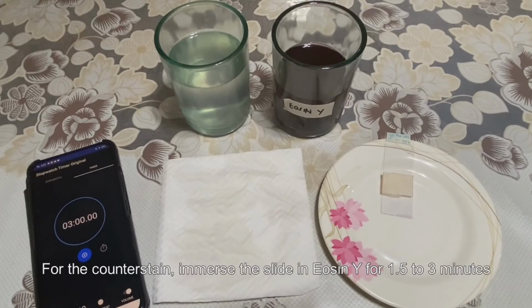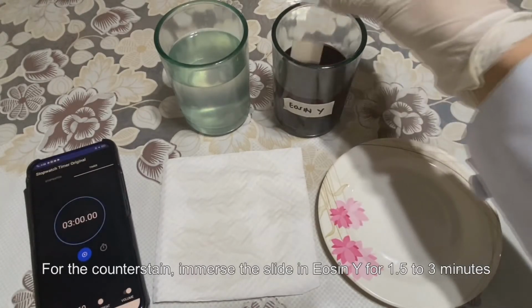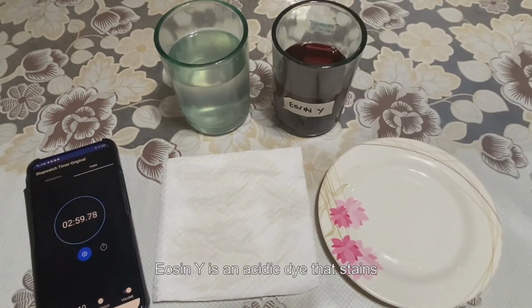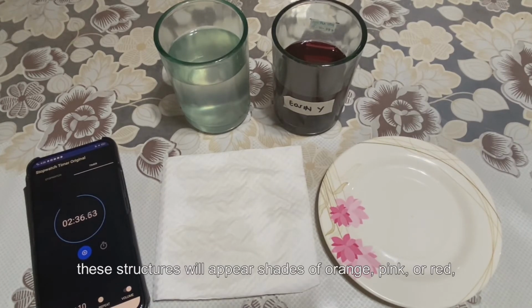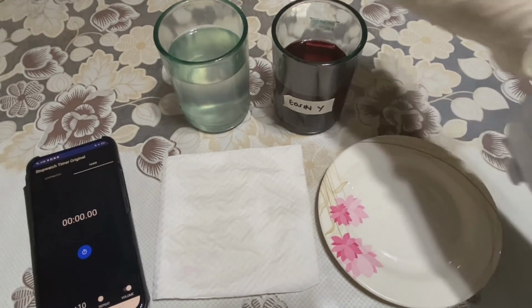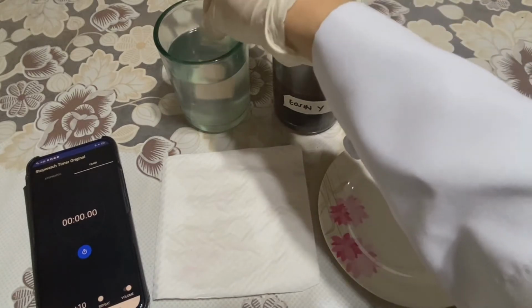For the counter stain, immerse the slide in eosin Y for 1.5 to 3 minutes. Eosin Y is an acidic dye that stains the basic components of tissues such as the cytoplasm and connective fibers. These structures will appear shades of orange, pink, or red, contrasting the purple-blue complex by the hematoxylin. Rinse and drain excess water.